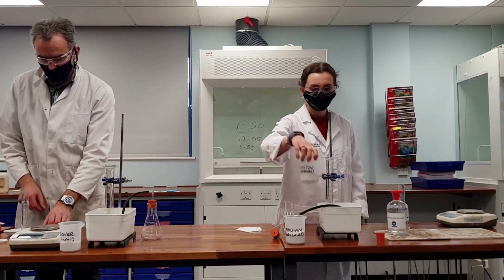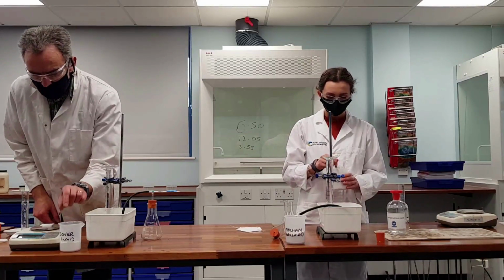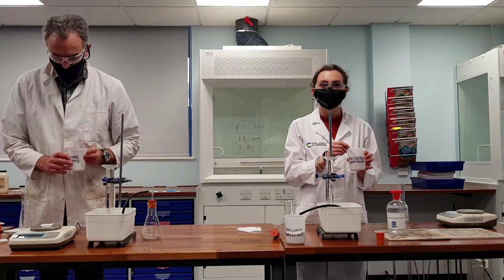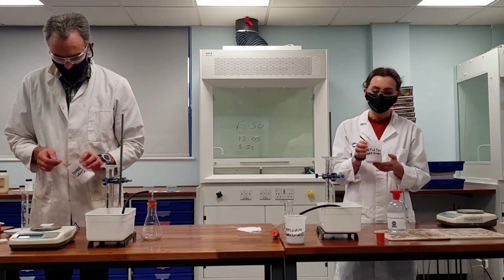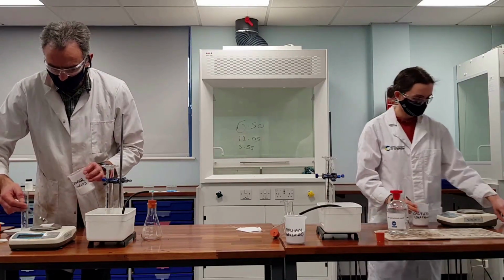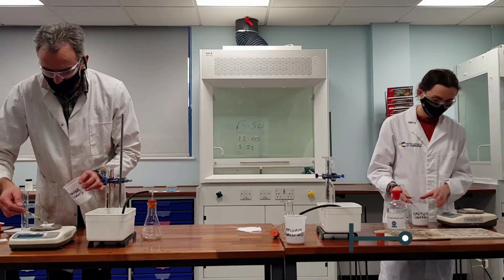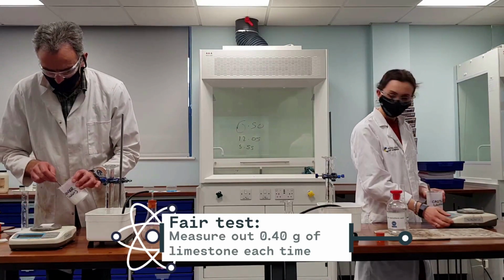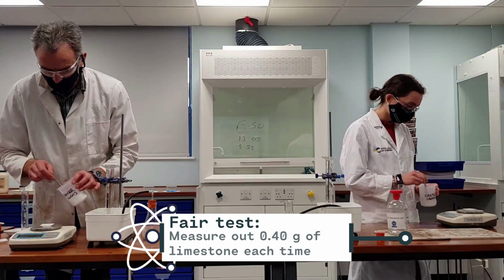So Mr. Reeves is going to measure out 0.4 grams of Dover limestone, and Miss Richardson is going to measure out 0.4 grams of Castleton limestone. So being as accurate as possible, we're going to measure out 0.4 grams of limestone.